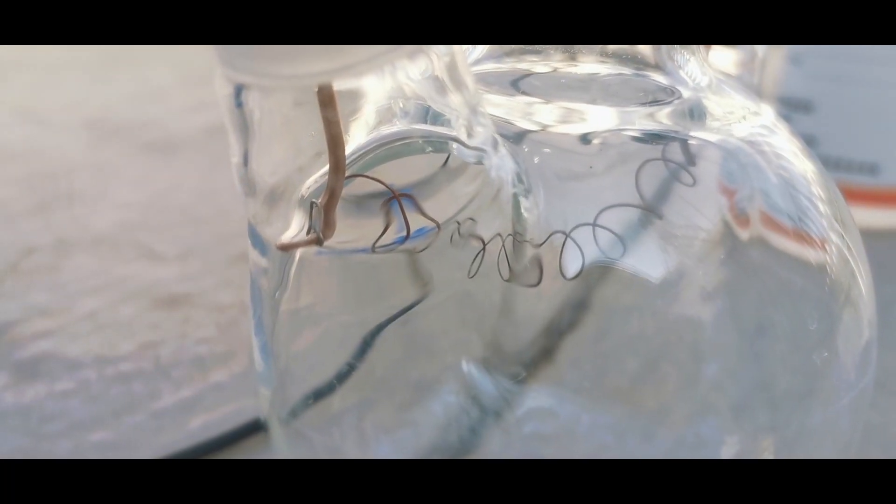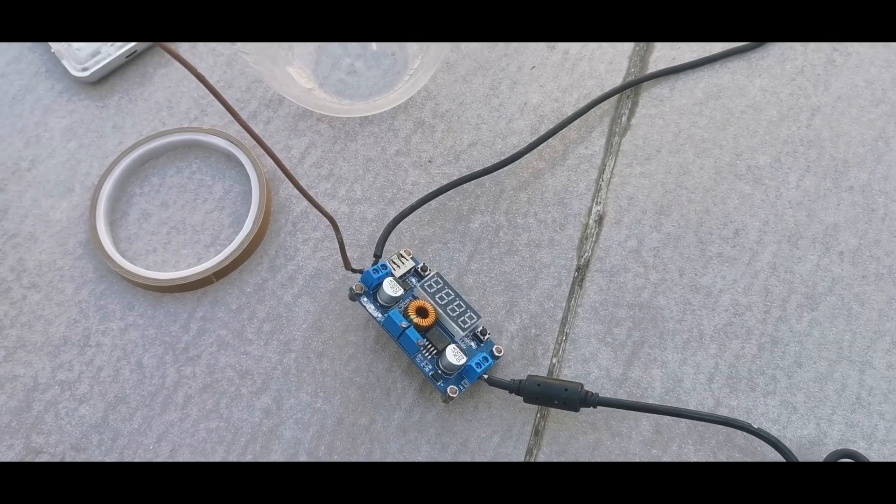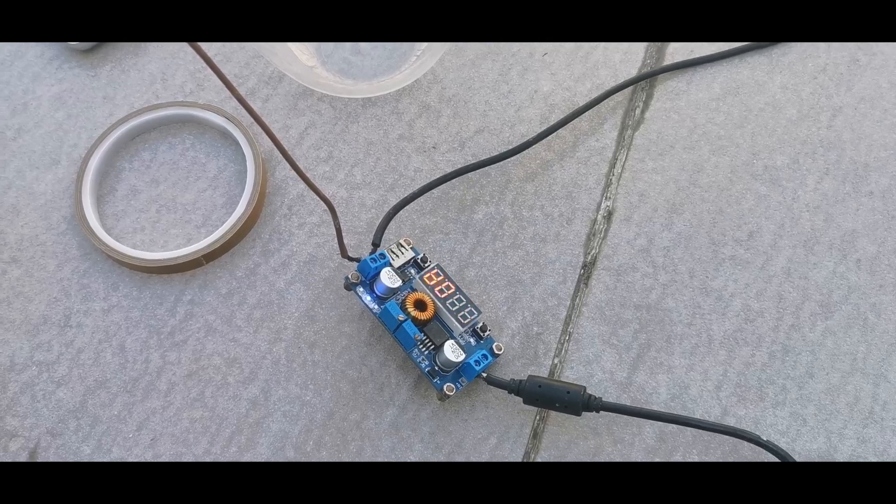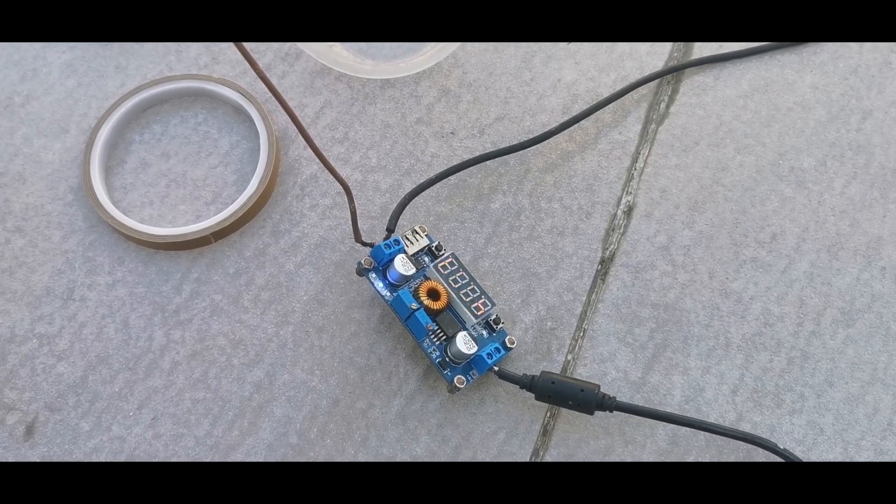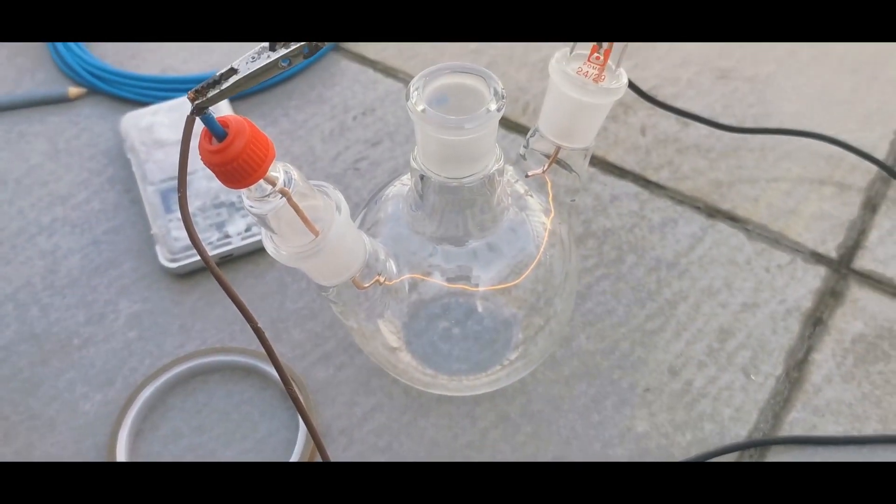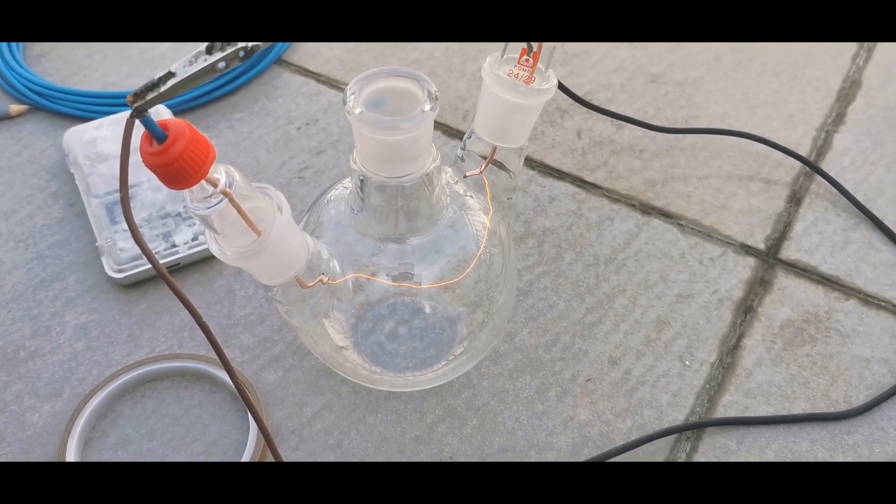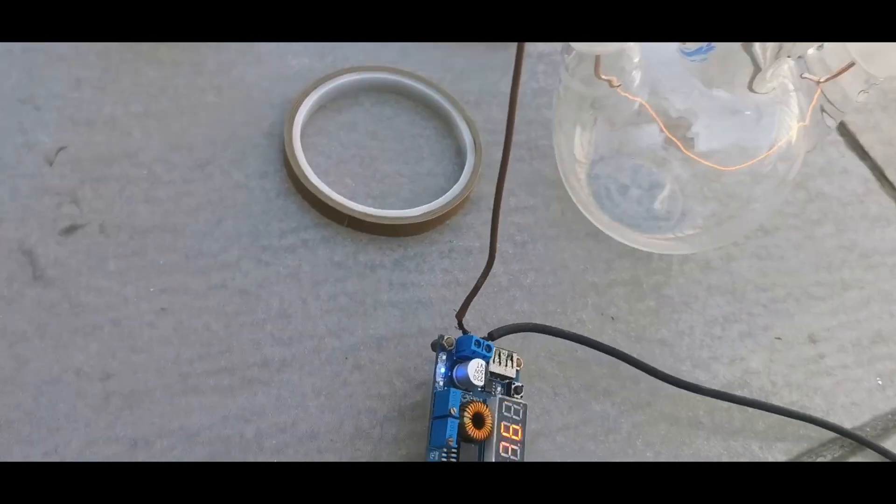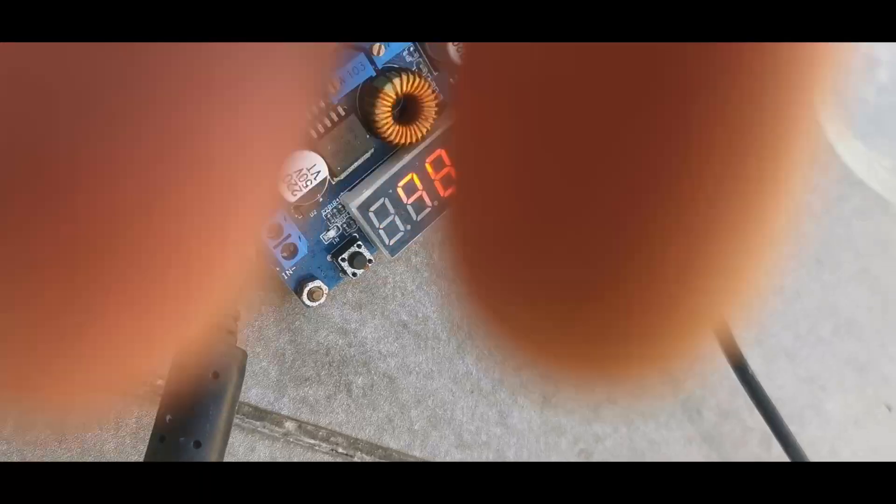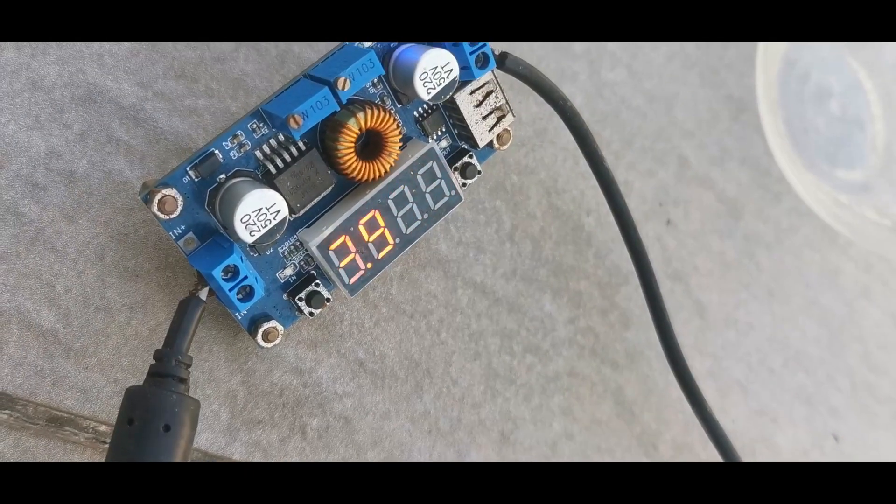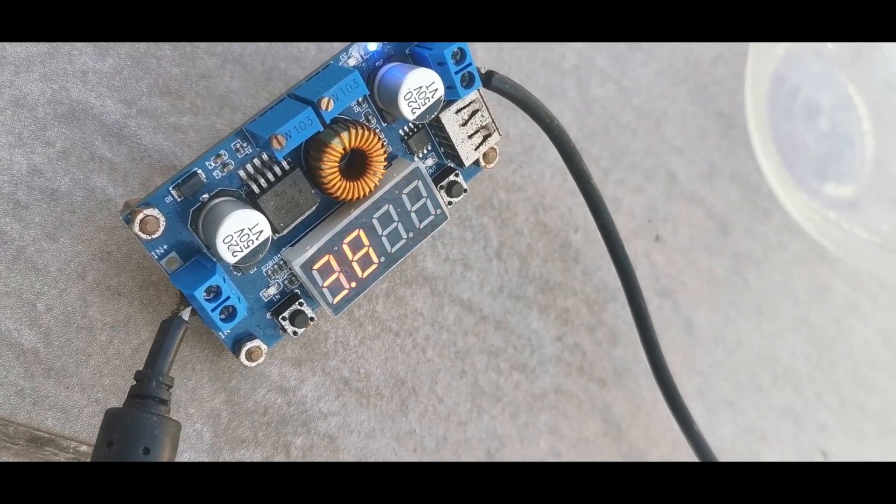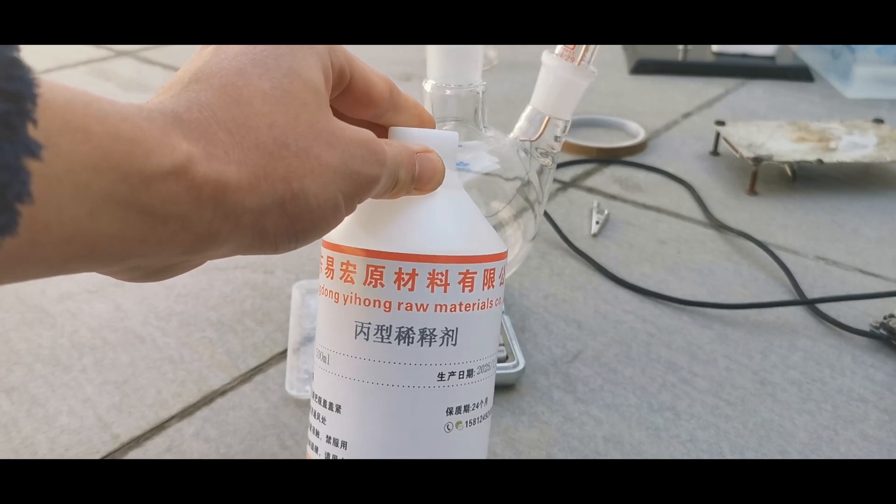So I need to switch to the thinner wire, and here I am testing with a piece of 0.3mm nichrome. At 4A of current, the nichrome glowed perfectly. Note that the acetone vapors will take away heat during the actual reaction, and thus lower the temperature of the nichrome. So in the reaction, we need to use a higher current than 4A to keep the temperature high enough. Make sure that your power supply can deliver this current. Now we solved the filament bit, time to get to the actual reaction.